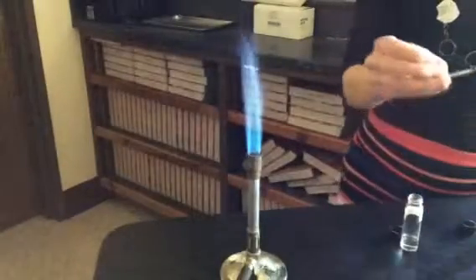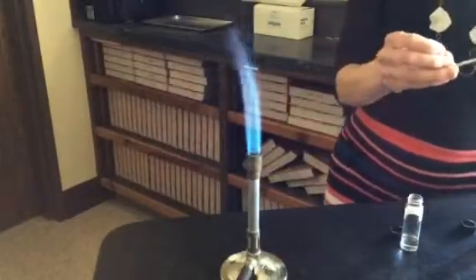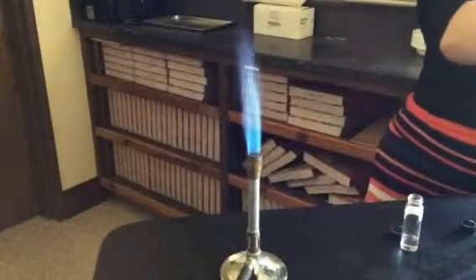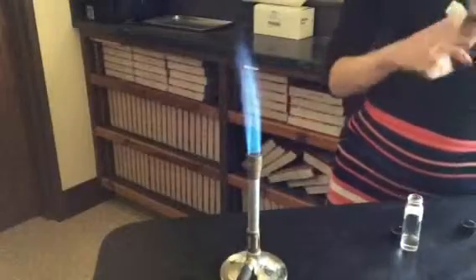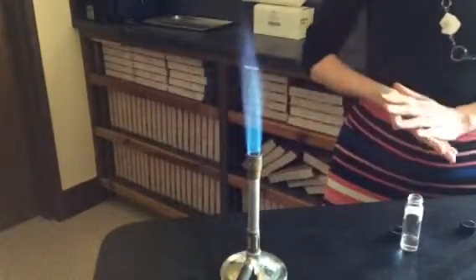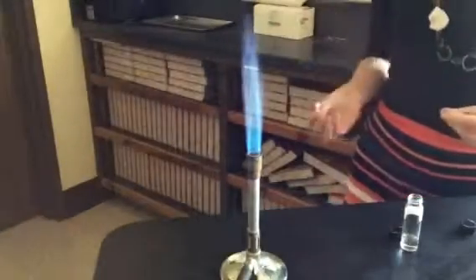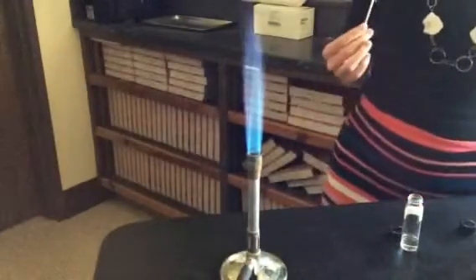So in your lab book, you might now write down that sodium is orange, so just write the color orange, and that is a very intense flame. That was a very intense color. So you could write bright or intense. Okay? I'm going to stop making a lot of comments and just let you observe and write down the data. So I'll just show you what the next element is.